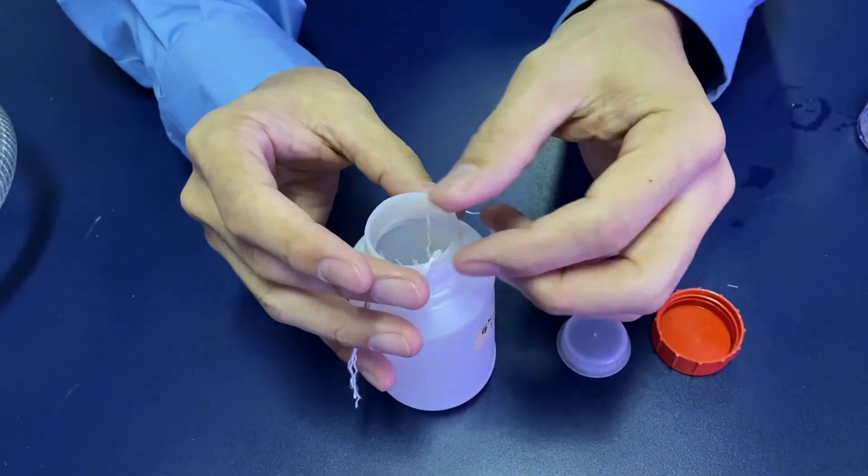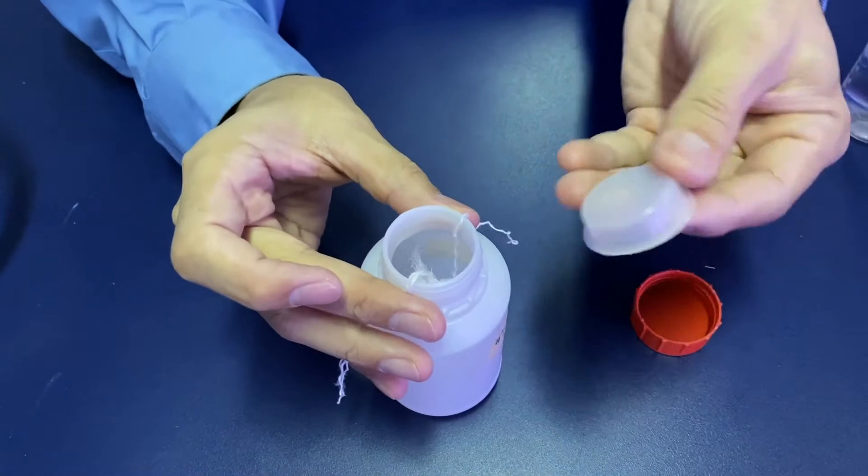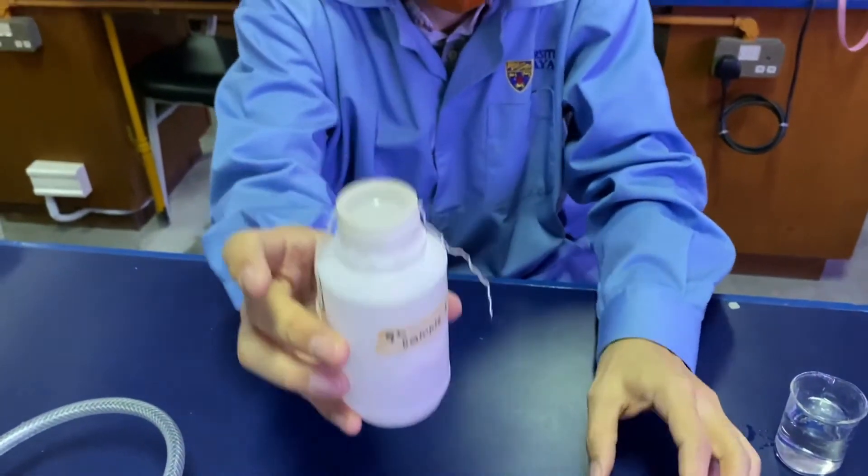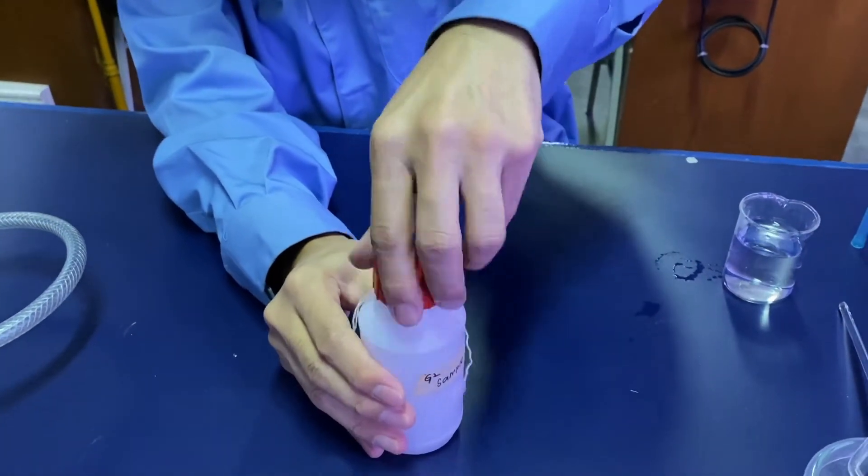Then you use the cap to lock the string in place.